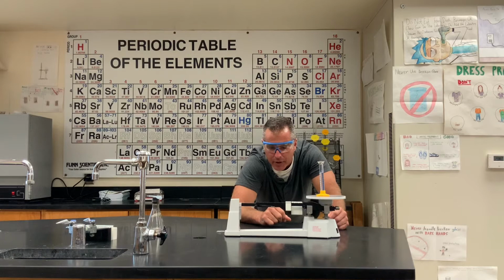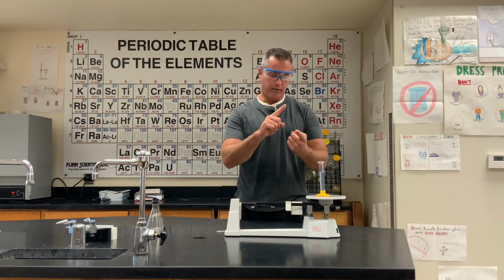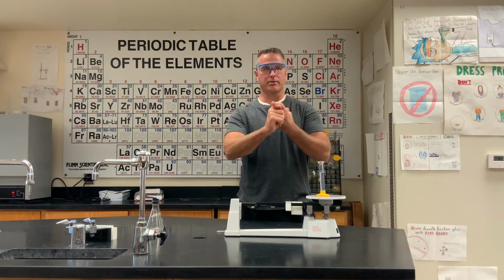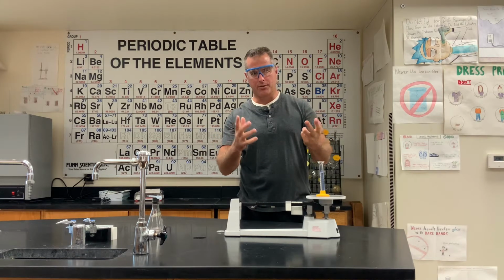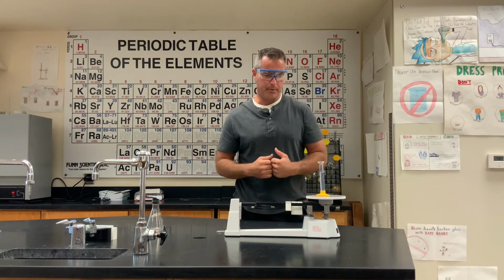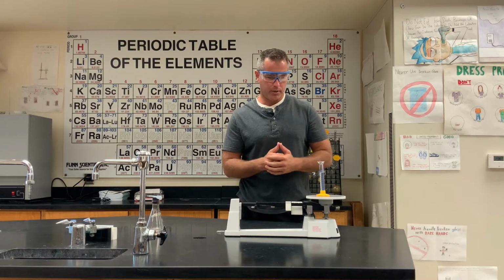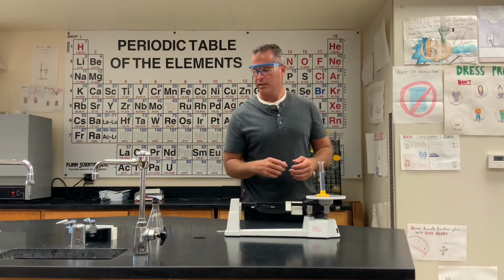So that's where we're at there. So now you have the mass of the empty cylinder and the mass of the full cylinder. If you subtract the 2, you should be able to figure out the mass of that liquid. All right, I just told you it was 10.00 milliliters. So that's what we're going to do for this one. We're going to come back and give you some data on the block.